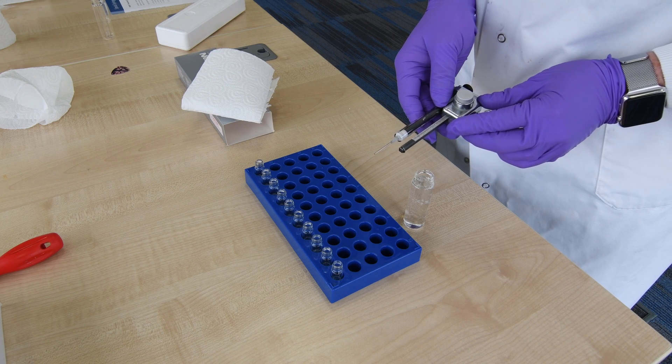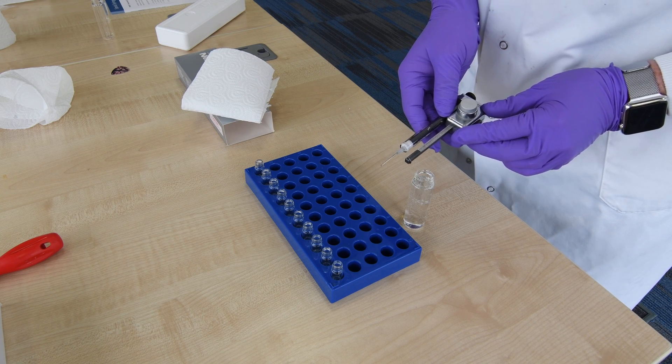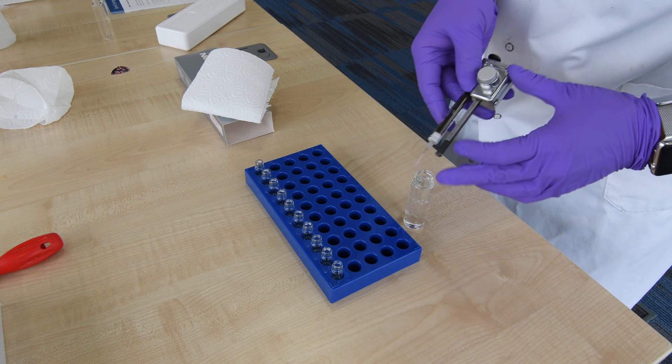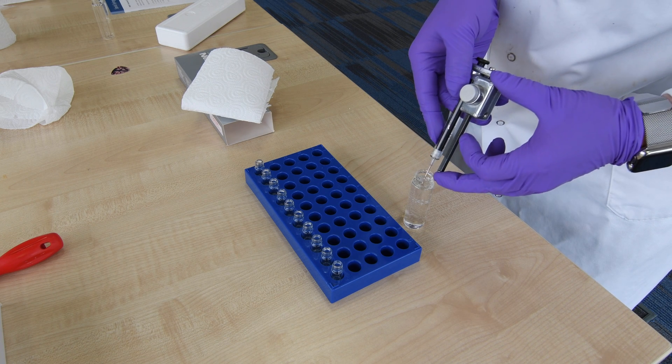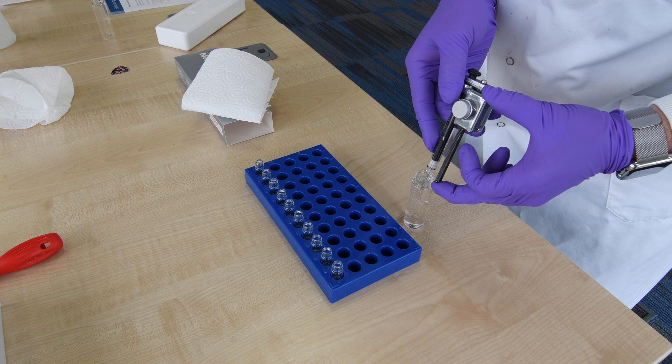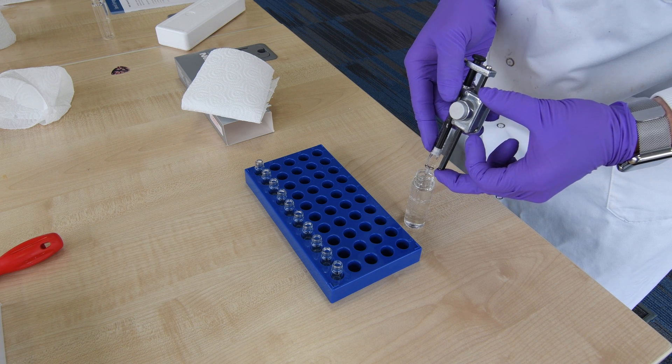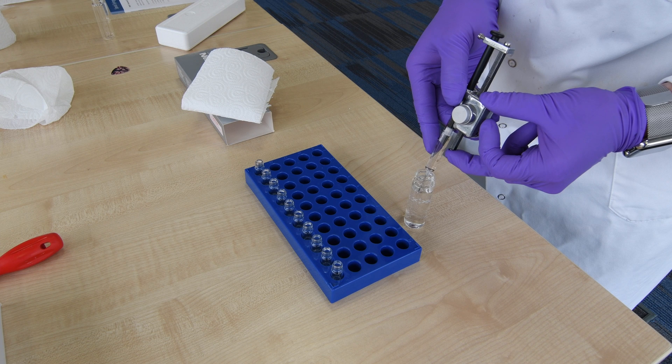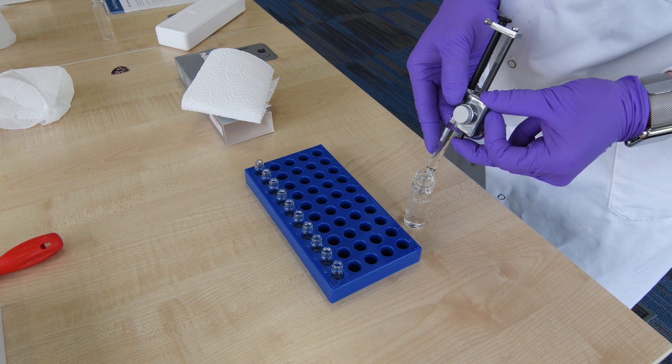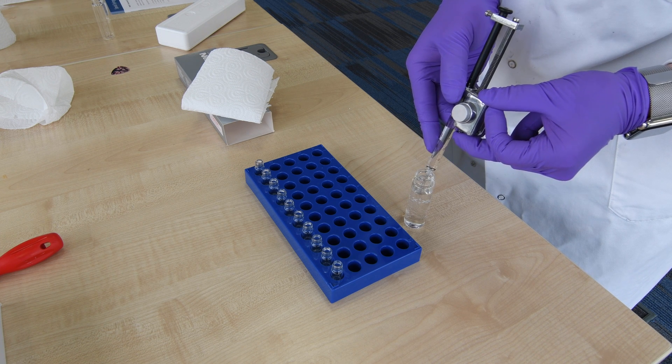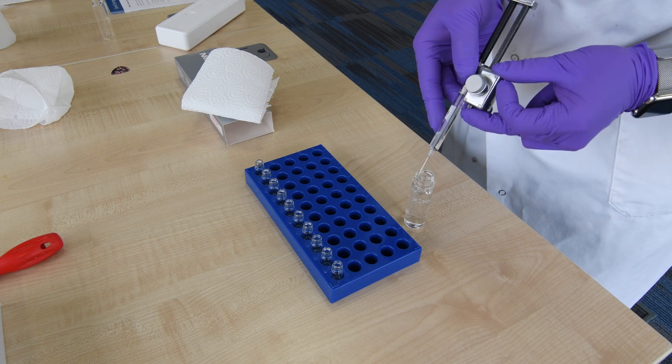The first stage is to aspirate the reference material you wish to dispense. We're pressing on the drive. We can easily aspirate the total volume you wish to use. The unused material can be returned to the standard bottle.